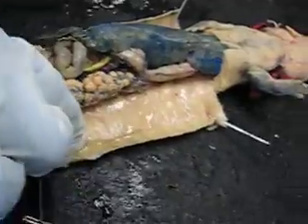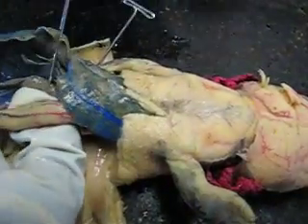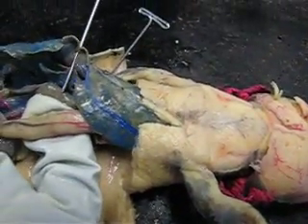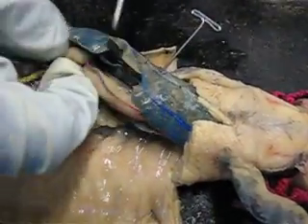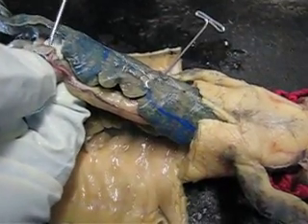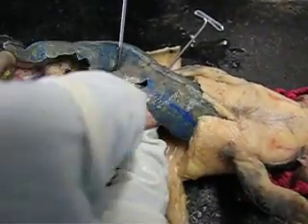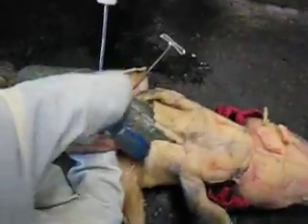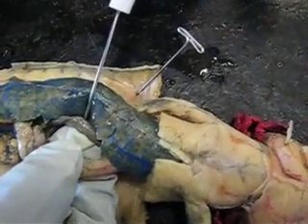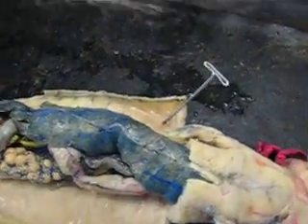Do you want me to do the mesentery? Do you know where the spleen is? I showed it at the beginning. This is the spleen. And then the pancreas is right here, right near the duodenum. So the spleen is near the left lung. Do you want me to do the mesentery?